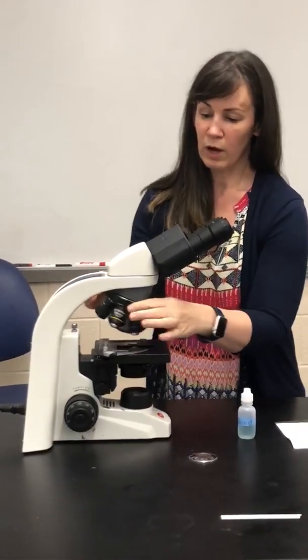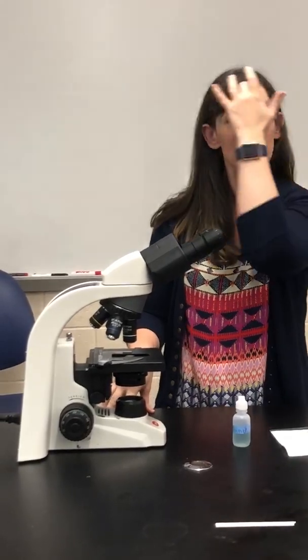When we use the 100x objective, we have to use an oil immersion. And because of that, our microscopes can get pretty oily and pretty messy. So it's really important that we clean our microscopes well. When you are done looking at a slide, you want to clean your 100x objective and any oil that is any place else. And you want to clean your microscope in between every single slide.